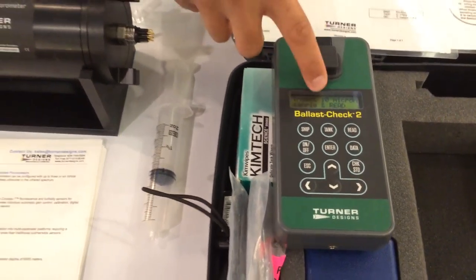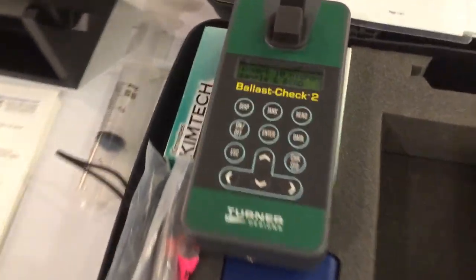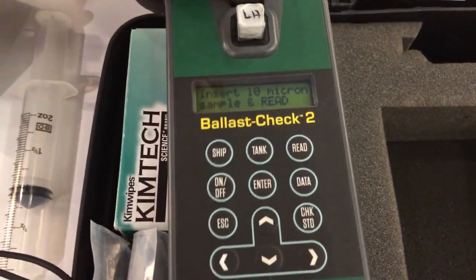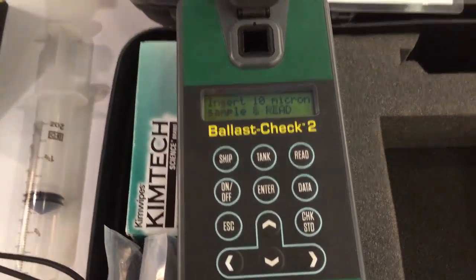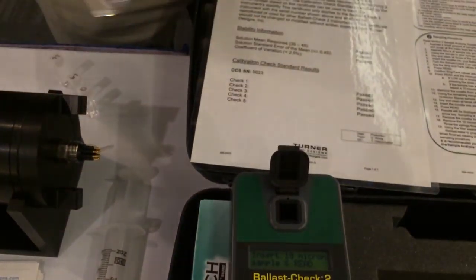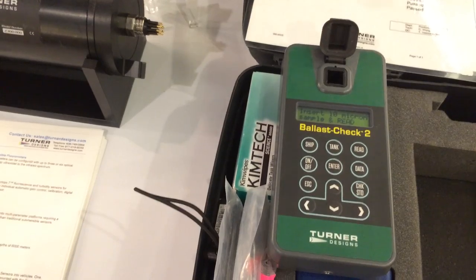This is telling you to insert a 10-micron sample. So what that means is there was a lot of fluorescence from this cuvette right here. There may be a lot of algae — but what other things can cause that? Dissolved organic materials.